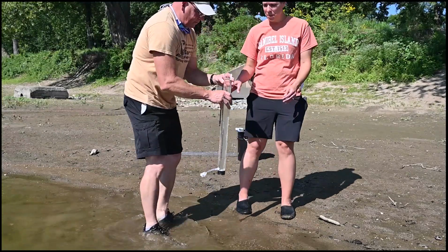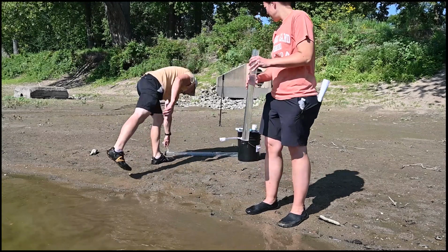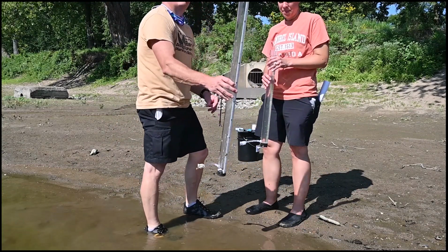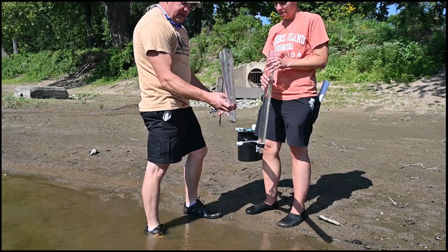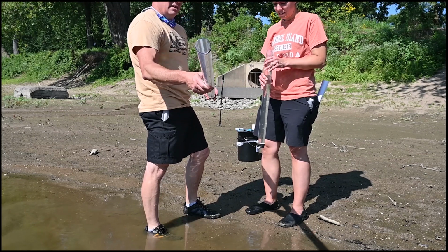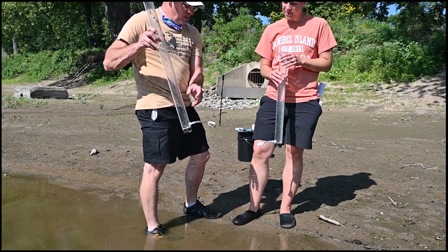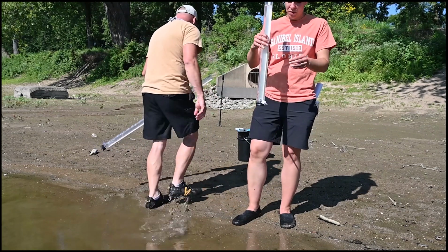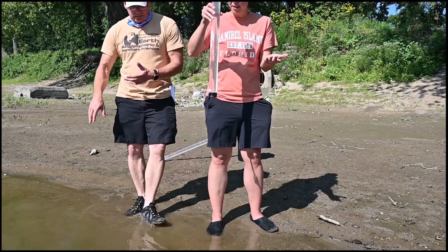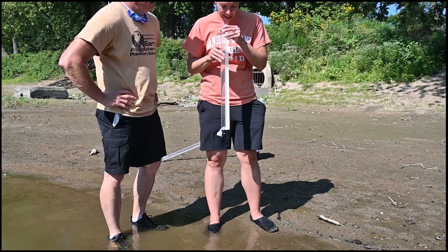And what we didn't show you at the beginning, there's a black and white disc at the bottom of this, and we'll show you a picture of this. And we'll do close-up pictures in there, but this is just a long, clear tube, and the bottom of it is a black and white disc. And this is a release on the bottom, so we can drain it. So Sarah's going to look through this. What we're looking for, so sometimes you look through and you think, well, this water's clear, I can see right through this. But when you look straight on, I can't see the black and white.